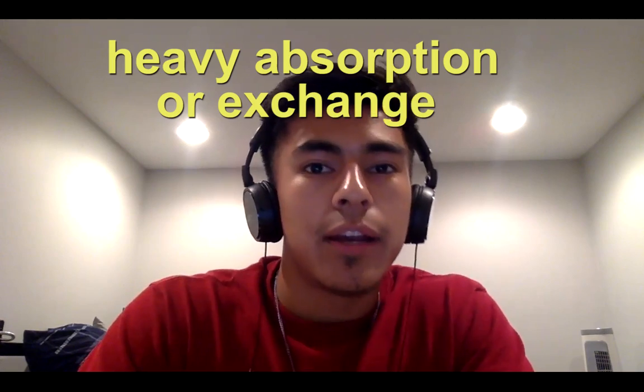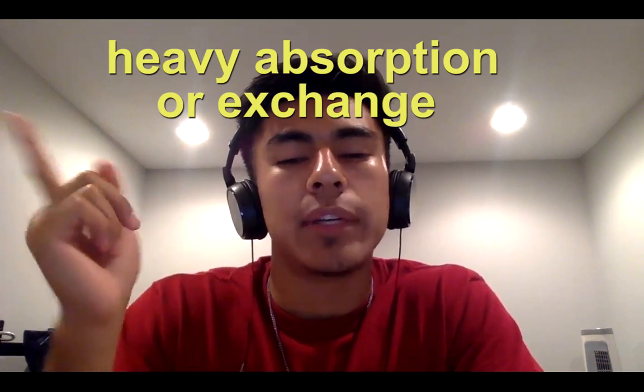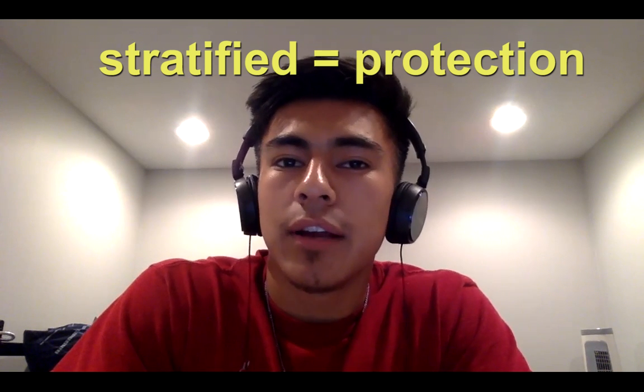Simple is really essential for absorption and secretion, and the reason for that is because there's only one layer of cells, it is extremely easy for nutrients, other elements, and molecules to transfer and to cross this layer. Stratified is really more so for protection. Not many things can get through because there's so many significant layers of cells with tight junctions, desmosomes, gap junctions. It just makes it extremely difficult for things to get through.